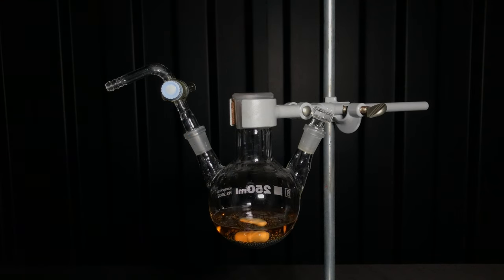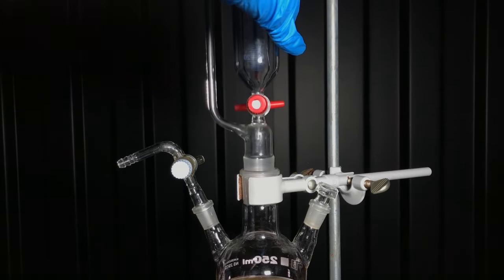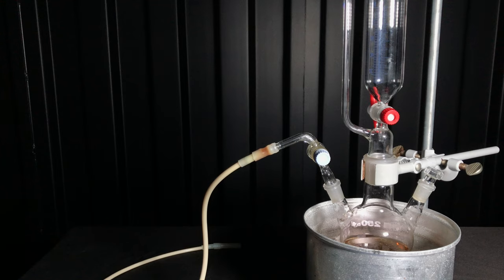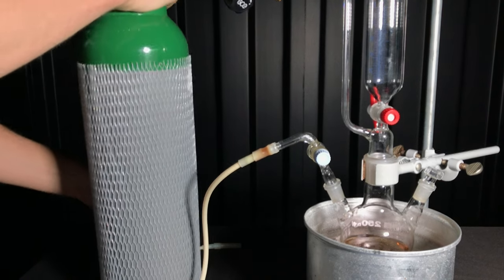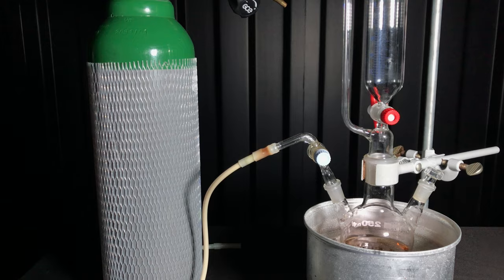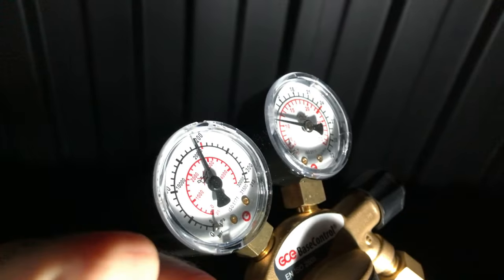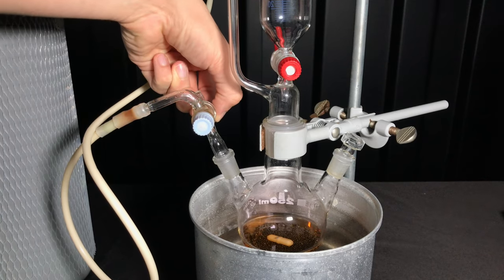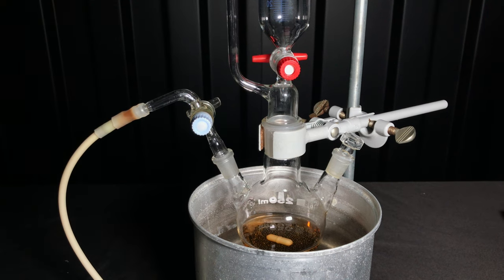We want the reaction to be as calm as possible and therefore the hydrazine hydrate is going to be added via an addition funnel. I never worked with hydrazine hydrate before. I have no idea if it can easily build up an explosive atmosphere. As a safety measurement, we therefore ended up flushing the apparatus with argon.